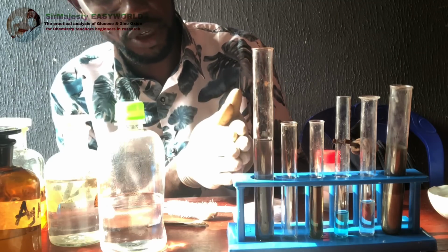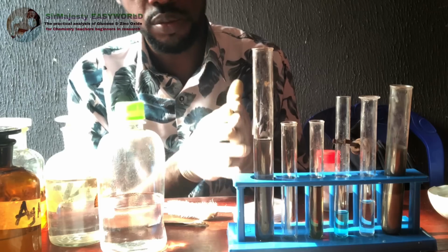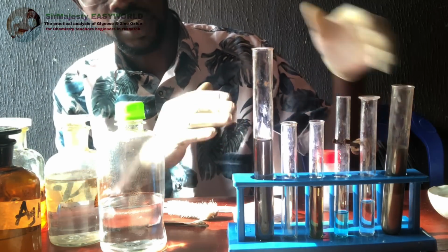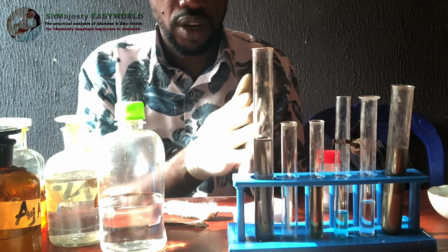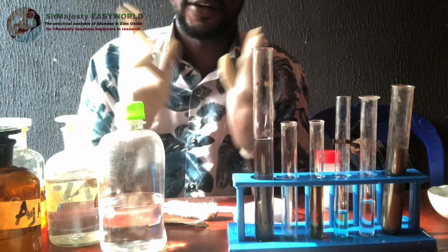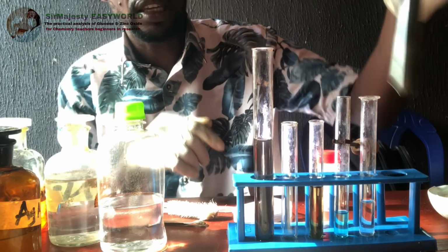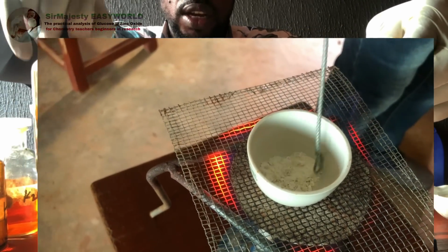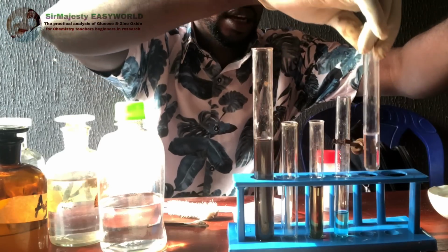Okay, now I think this is possible because suppose you want to check the time interval. If this can form in 10 minutes, it means that the silver mirror experiment might be possible. But for you to get a clear result, you have to take 30 minutes, and you see this test tube being covered with a nice and smooth looking silver metal. So what is covering here is actually metallic silver, which was reduced from the silver ion, that's the diamminesilver(I) ion that was formed from the Tollens' reagent. The glucose solution reduced the silver ion to silver metal, and that makes this test tube shine like a silver coating.